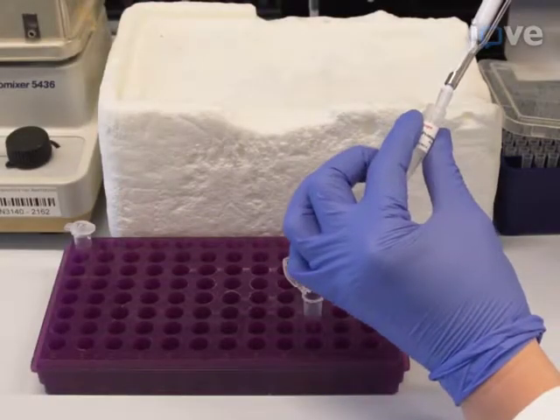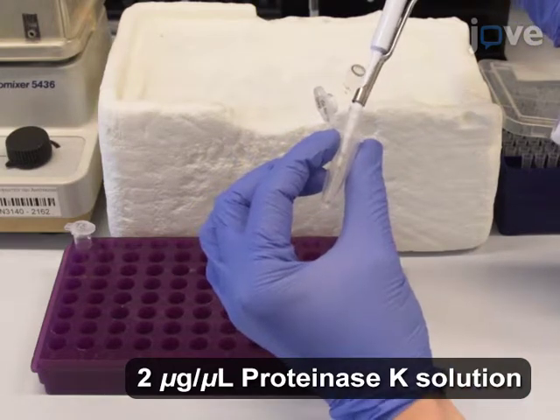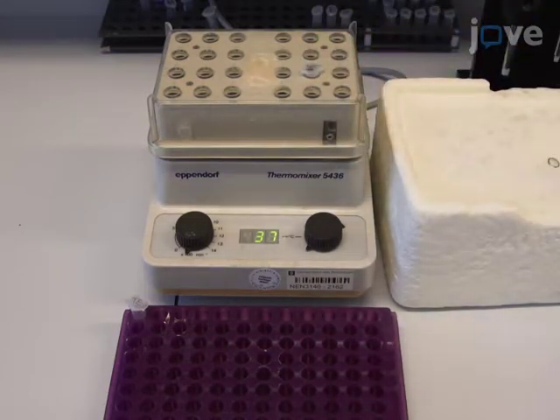Terminate the LR reaction by adding 2 microliters of proteinase K solution to the mixture. Mix and incubate at 37 degrees Celsius for 10 minutes before proceeding with transformation into E. coli as described in the text protocol.